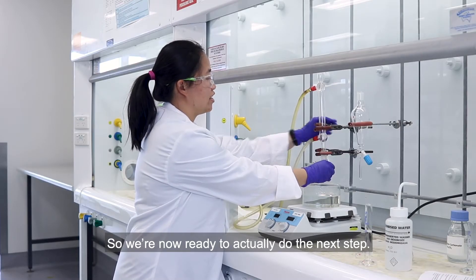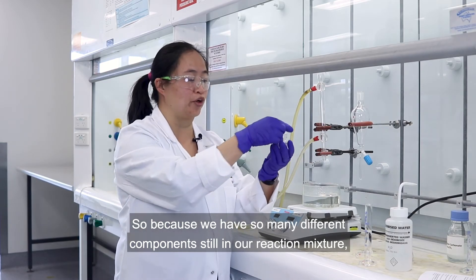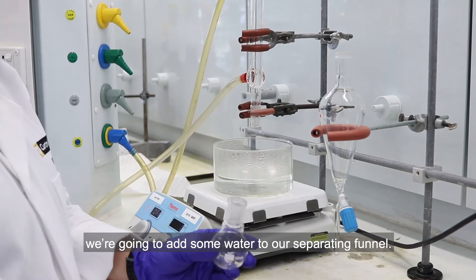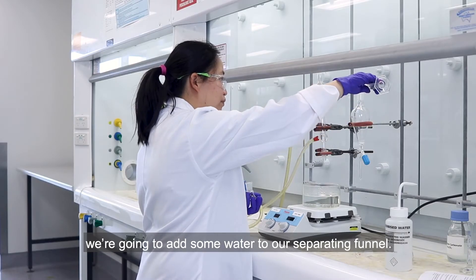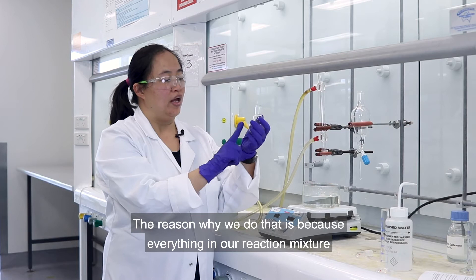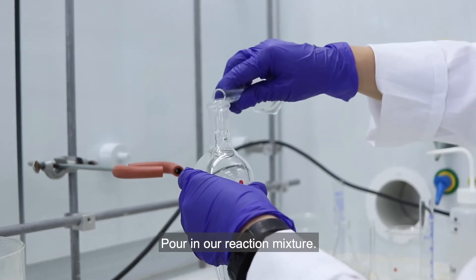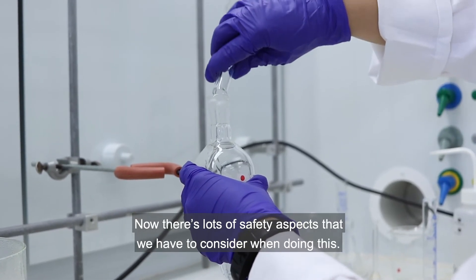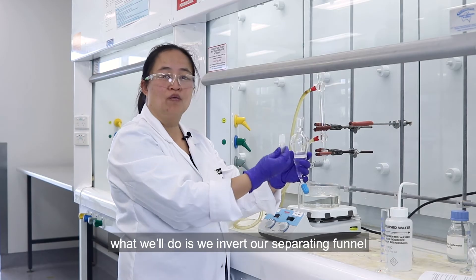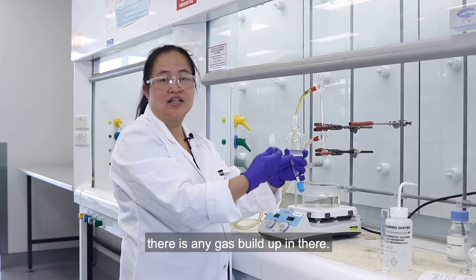So we're now ready to do the next step. Because we have so many different components still in our reaction mixture we want to isolate our product, and to do that we're going to add some water to our separating funnel. The reason why we do that is because everything in our reaction mixture is water soluble except for our product. Pour in our reaction mixture. Now there are lots of safety aspects to consider when doing this. I haven't put the stopper on yet because as soon as we put the stopper on, we invert our separating funnel and immediately release pressure in case there's any gas build up.